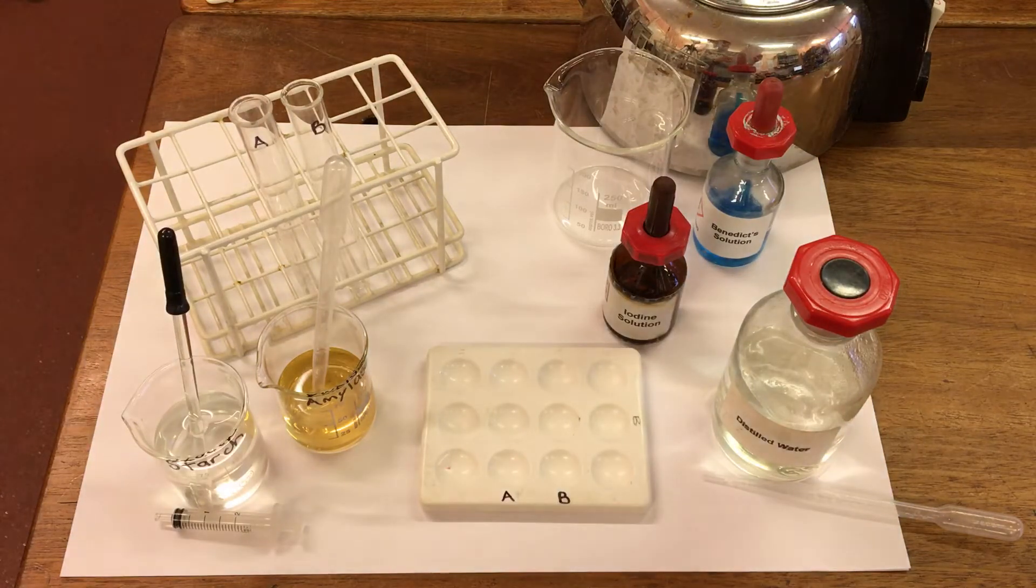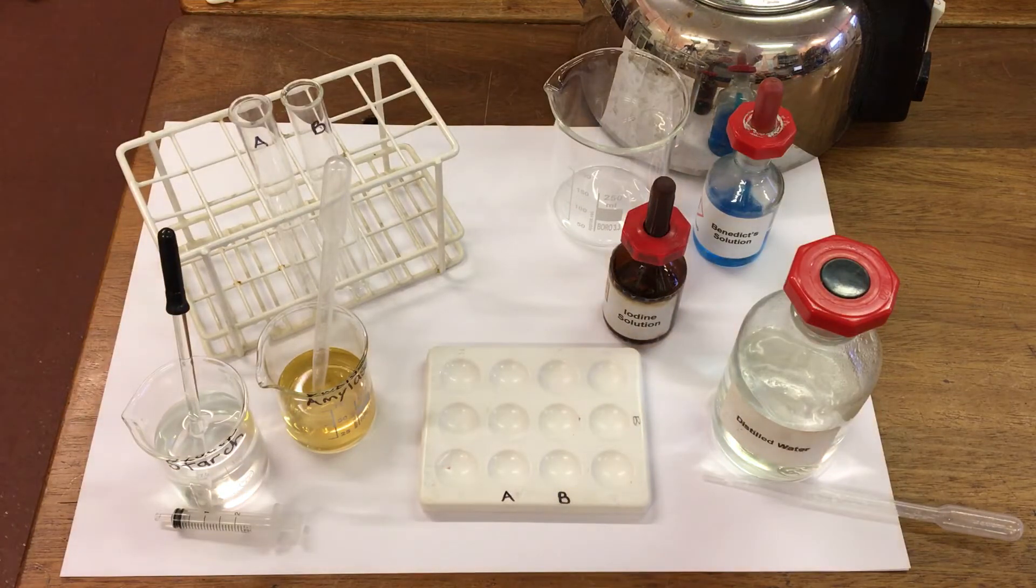In this experiment, we're going to investigate the effect of an enzyme called amylase on starch.